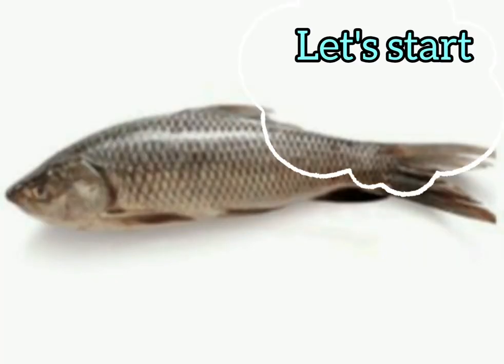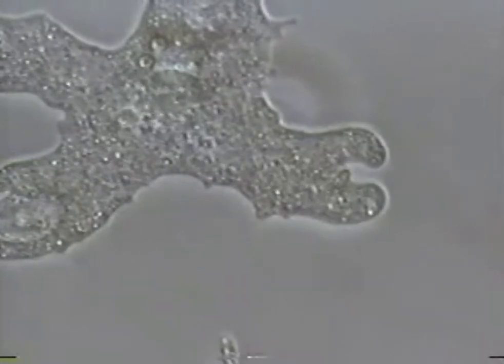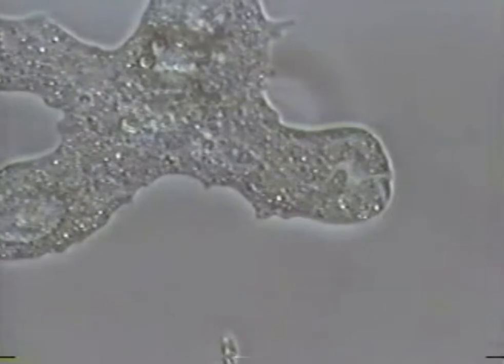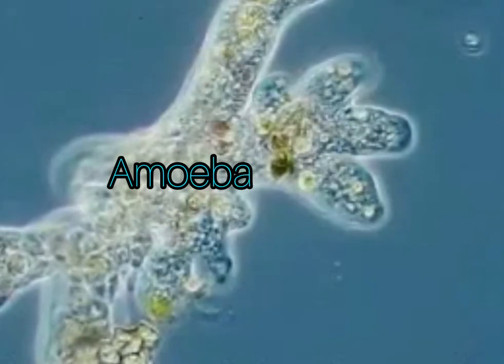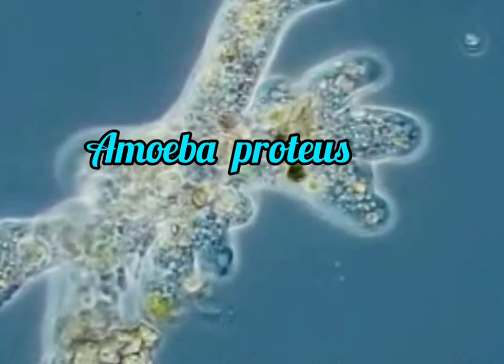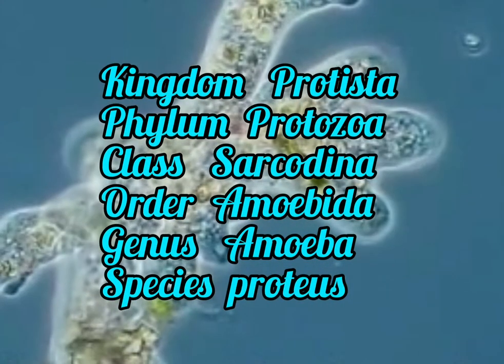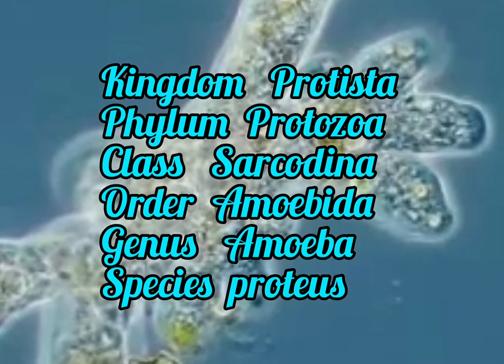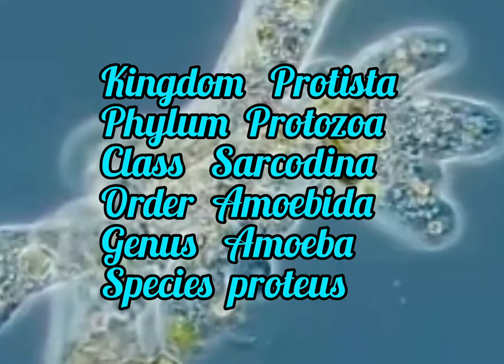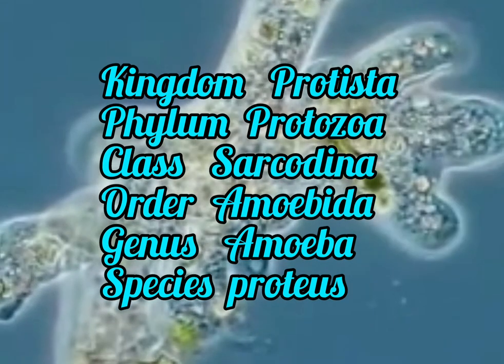The first organism I am going to discuss is a unicellular organism from the kingdom Protista, that is Amoeba, which is commonly known as Amoeba. The scientific name is Amoeba proteus. The hierarchical classification of this organism is: Kingdom Protista, Phylum Protozoa, Class Sarcodina, Order Amoebida, Genus Amoeba, Species proteus.